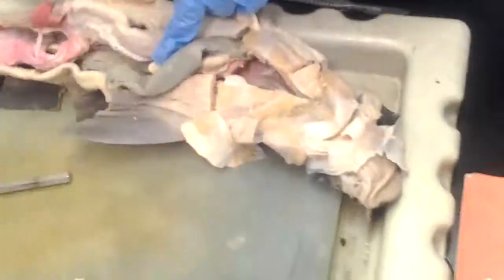Yeah. So mesogaster, let's see if we can see this one. Gastrosplenic, right? Yeah, I think the mesogaster is kind of ripped off on this one. I think this is a little bit of it.